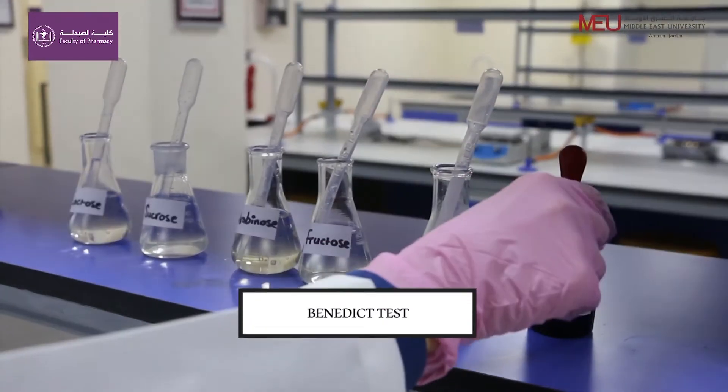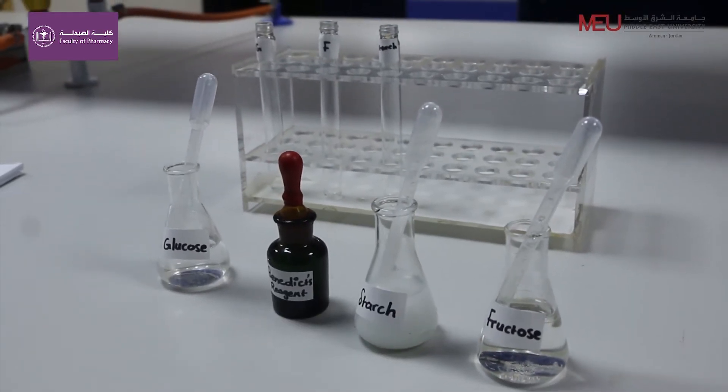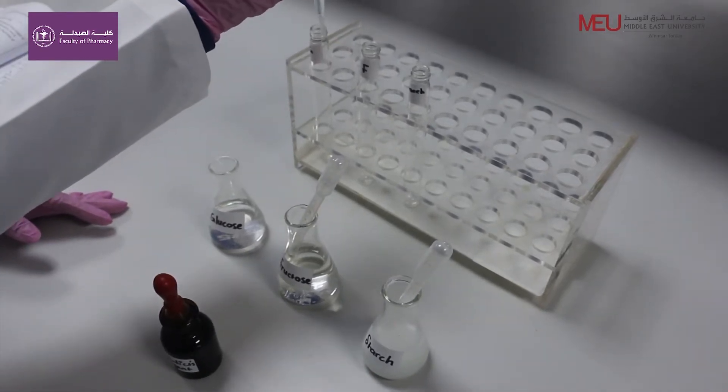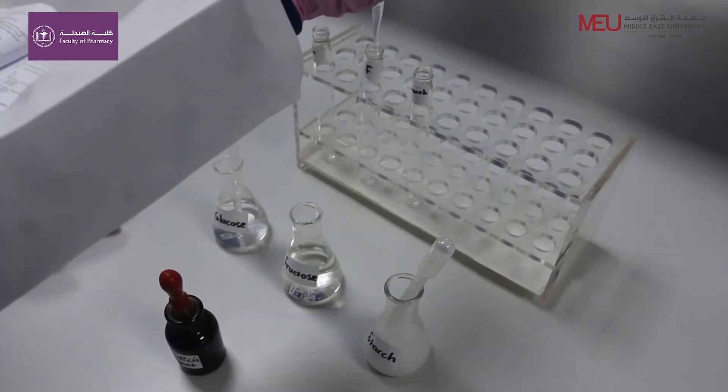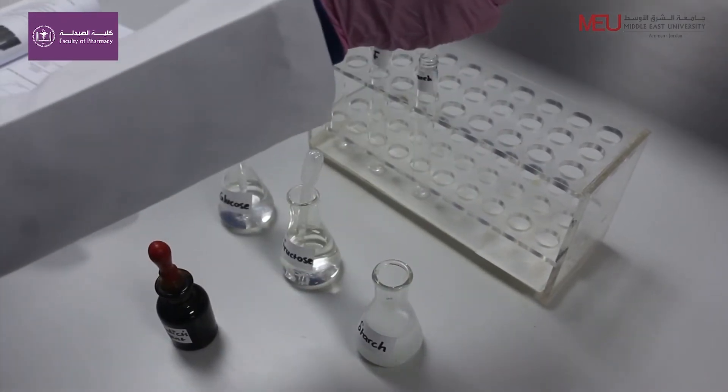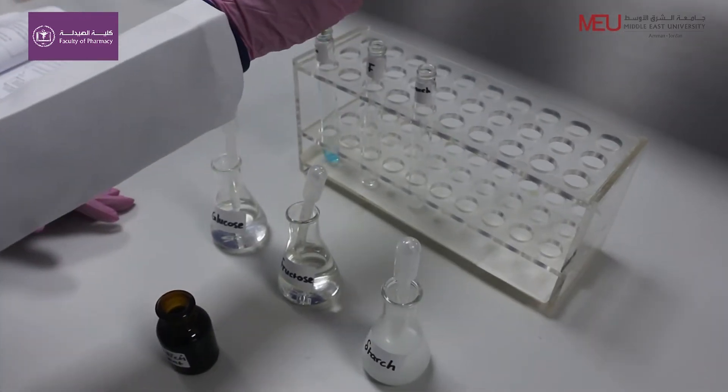Benedict test. Benedict test is used for the detection of reducing power of sugar. Add 8 drops of sugar solution.